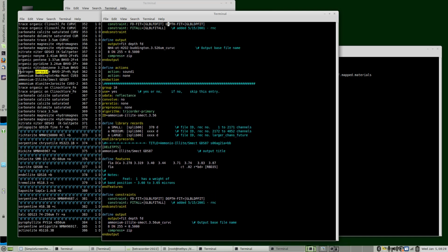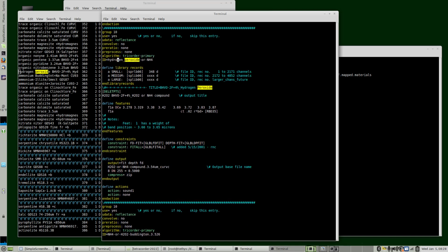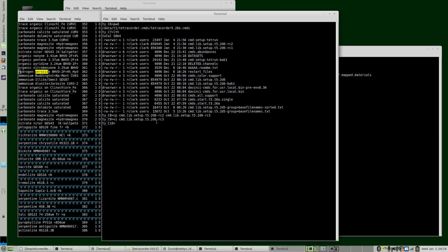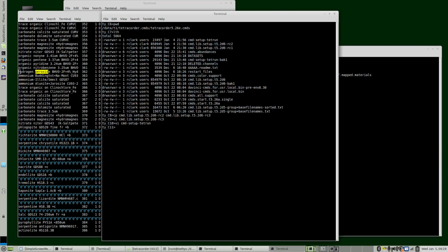So with that, we're less certain on the output, and the output names will reflect that uncertainty. Have to spell correctly. Check our spelling up here, okay, so that's good. So we've made that change. Let's also change the setup. Okay, so now we're all set with that new command file, and if we rerun the example over here, it would reflect those new names.